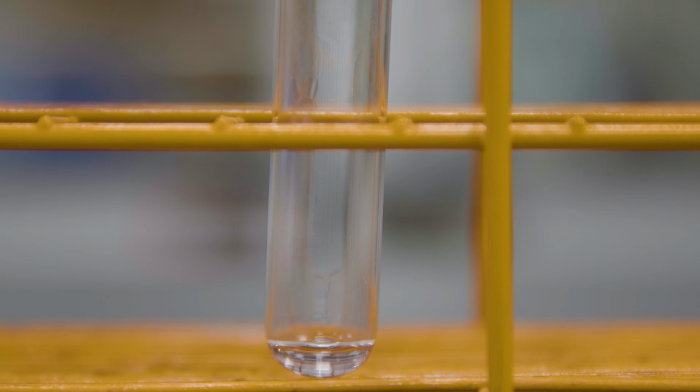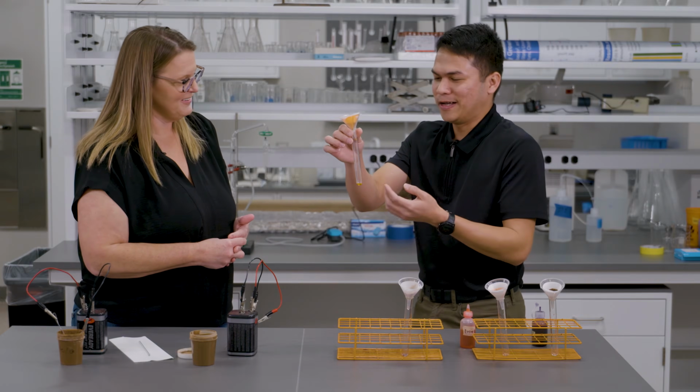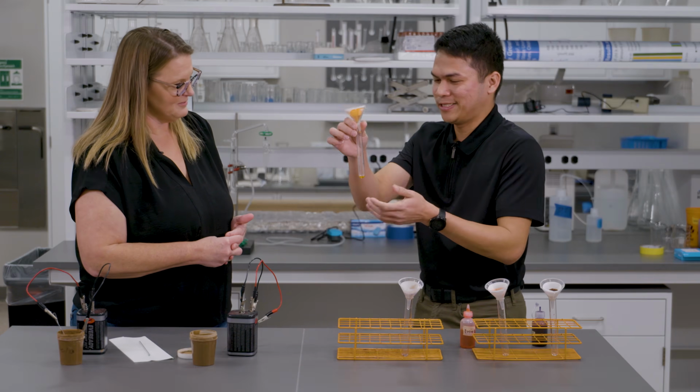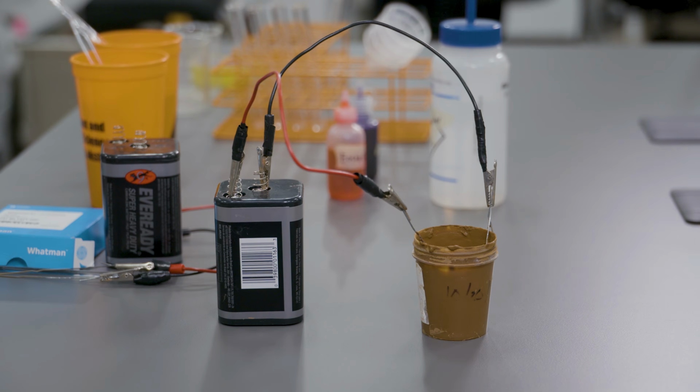And the negative dye, this one is just like the magnet thing, you know? Same charge repels, opposite charge attracts. Right. That's why we have this still orange leachate. All right. And so we've got another little setup here with batteries.